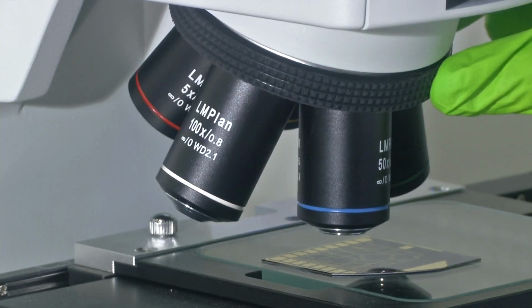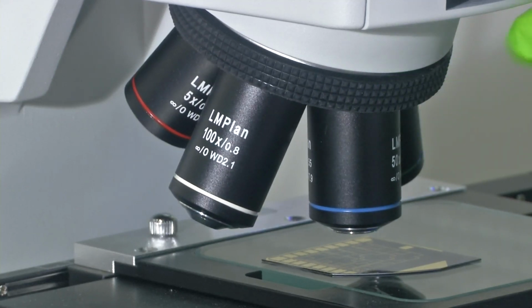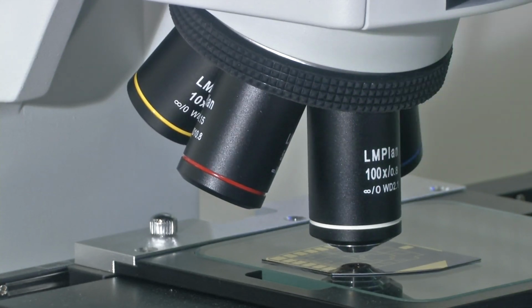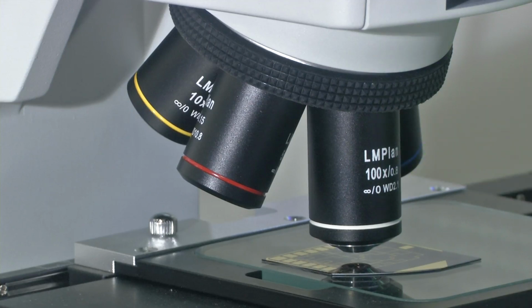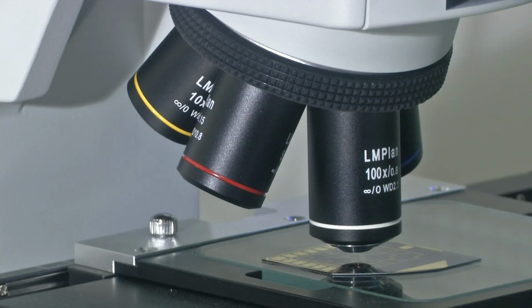Let us say I fix it to 50x. If you heard the click sound, that ensures the proper seating. So, now as you can see, there is 50, 500x. Let us see, there is 100x, 100 into 10. So, 1000x is the magnification the metallurgical microscope can provide. Each of these objective lenses has the magnification power mentioned on it, and there is also a working distance on each of them.